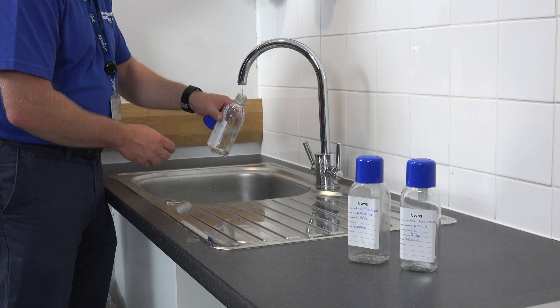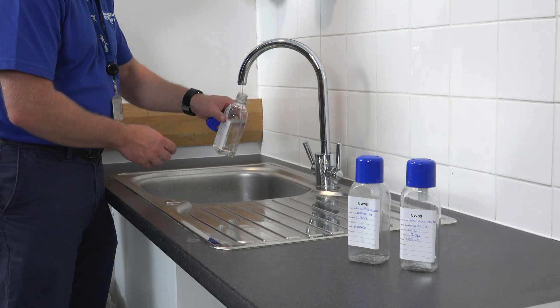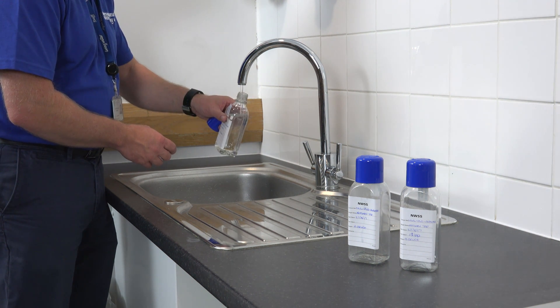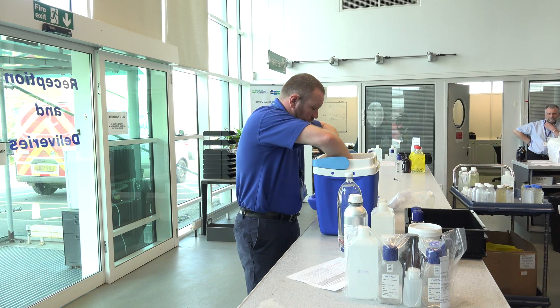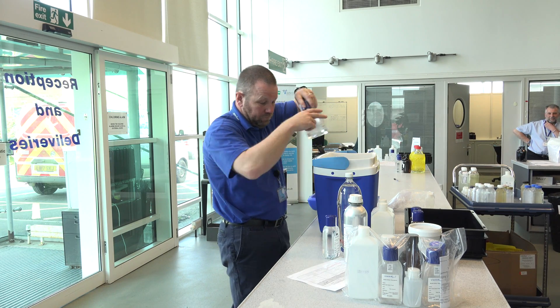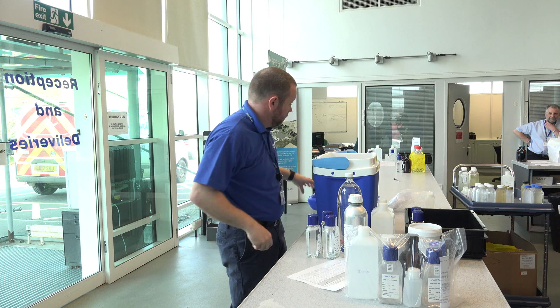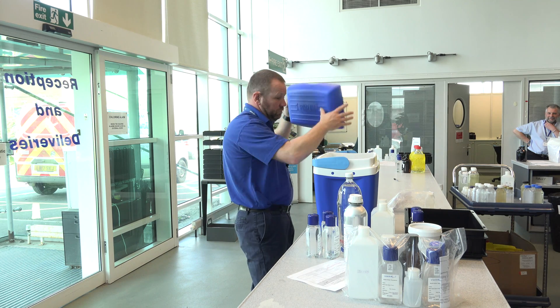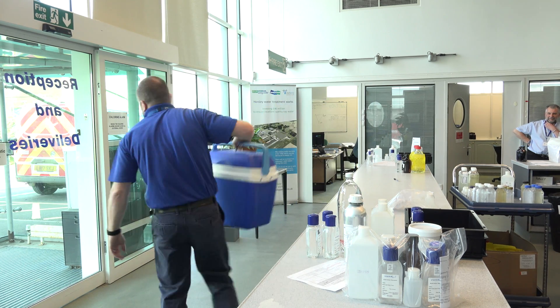The aim of sampling is to take a representative volume of water into an appropriate vessel, and to transport it to the laboratory in a way that limits any changes that might occur before it is analysed. To achieve this, there are a series of recommended steps that should be followed.